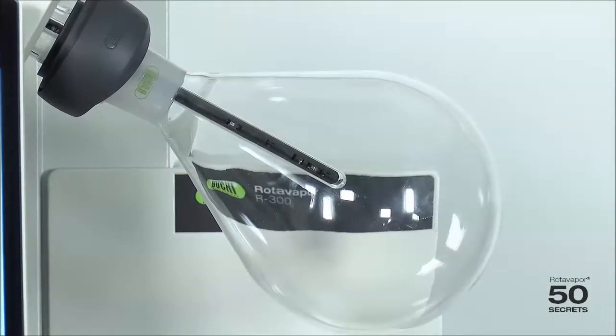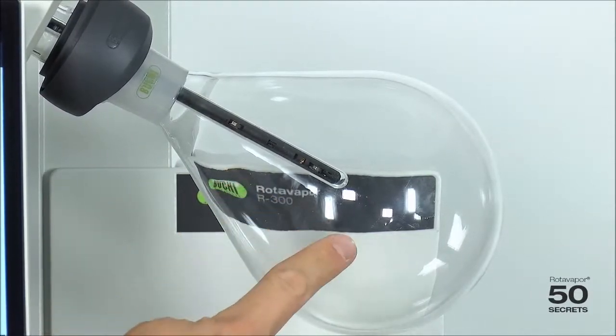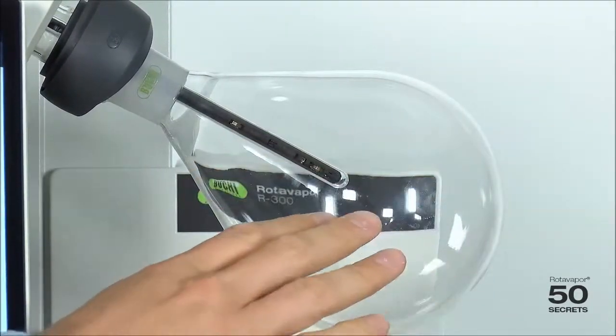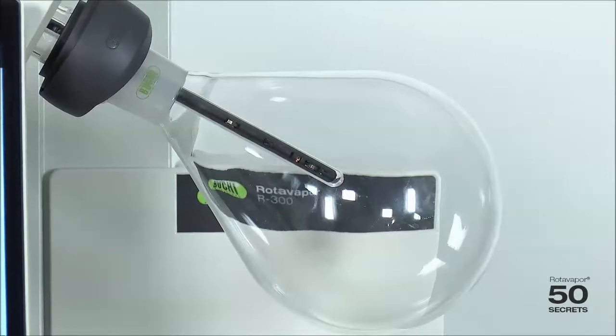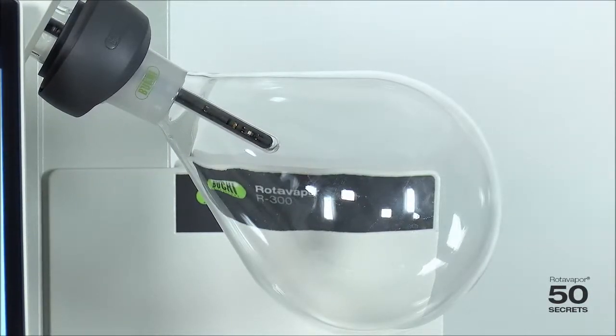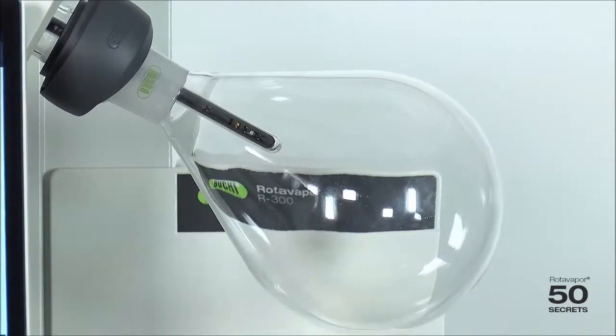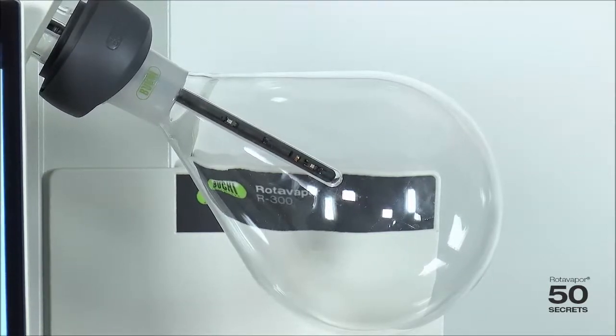It's very important to adjust the depth of the foam sensor to the flask size and your sample. So the smaller the flask size is like this, you go up with the foam sensor or down if the flask is bigger.